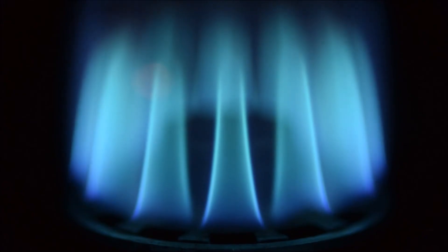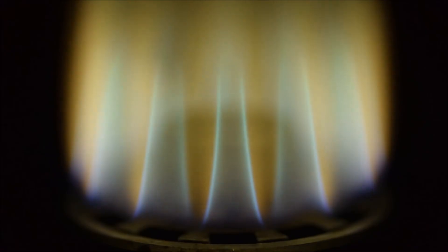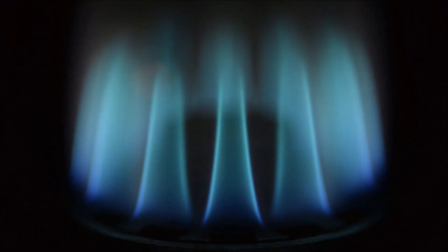Flame photometry can be applied to many different metals. Here's one or two other examples. If we see barium, we expect a pea green flame. If we have lithium, we expect a red flame. We'll see that in a minute. Hopefully when you look at these, you can see why it's important to wait 20 to 30 seconds to make your reading, because it takes a while for the flame to become consistent.